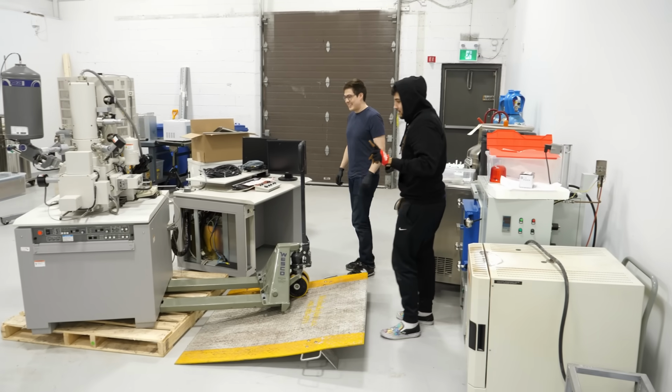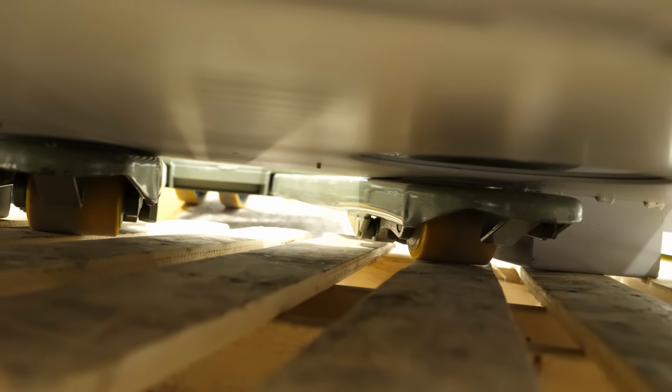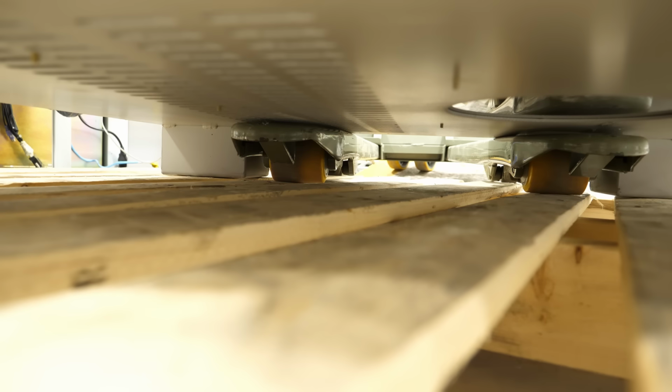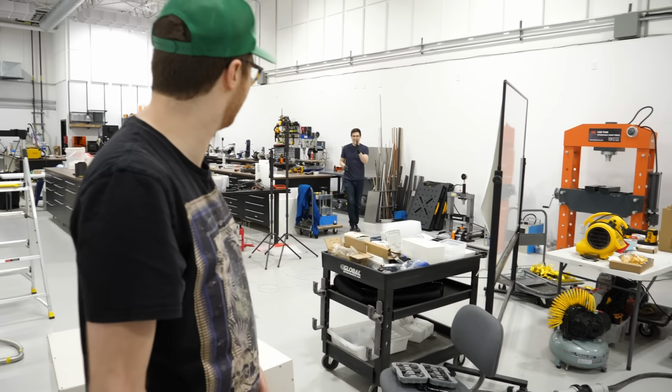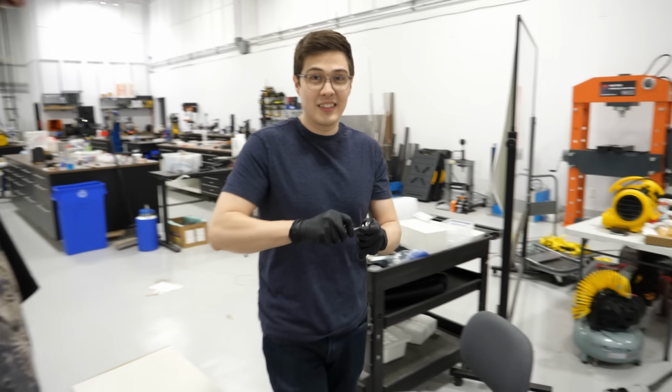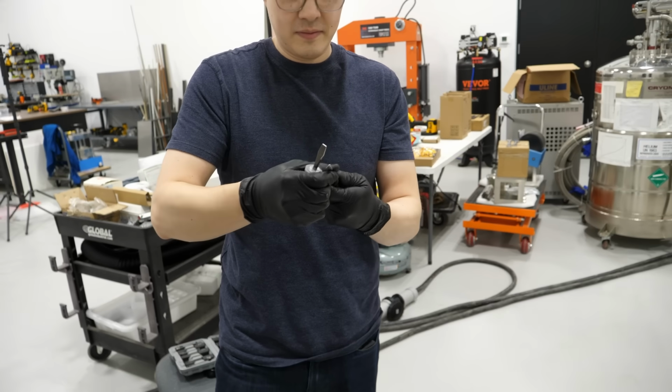Not necessarily. These are the screws right there. One, two... Ready to say goodbye to them? It'll probably fit on this side, but it's smaller than the other. Alright, go in! Multi-tool. It doesn't fit. I think a little saw would work. We can't put our hands through with a screwdriver and undo it, eh? No, it's not that kind of screw. What about this idea? Look at my saw. It's a jigsaw blade wedged into... Into what, just a holder?